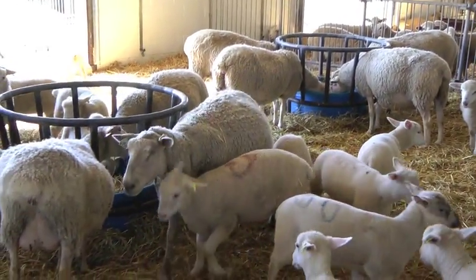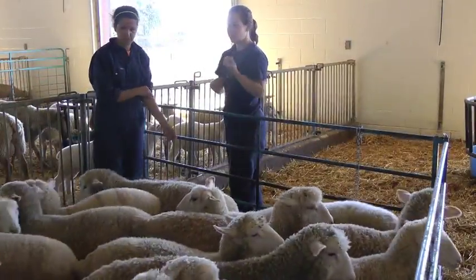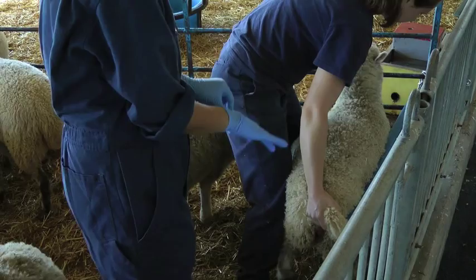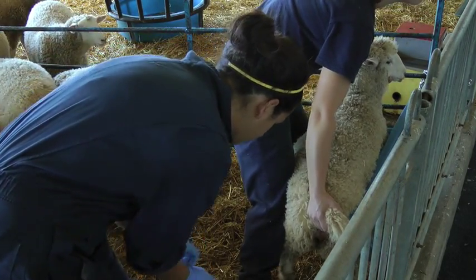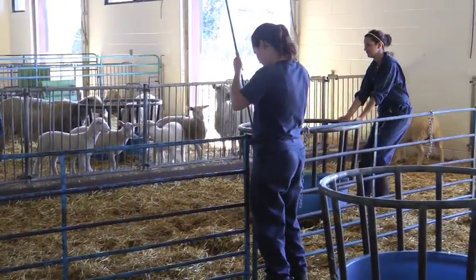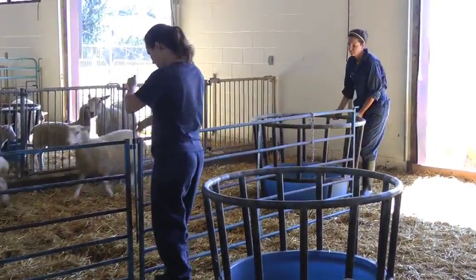The second method involves collecting fecal samples from the rectum of the sheep, and it's best to have two people when you're doing this. The advantages of this method are, you know that the samples are fresh, which animal was sampled, and that the fecal pellets are absolutely free of contamination. To make this process easier, run the sheep into a chute, or have one person restrain the sheep while the other collects the fecal sample.